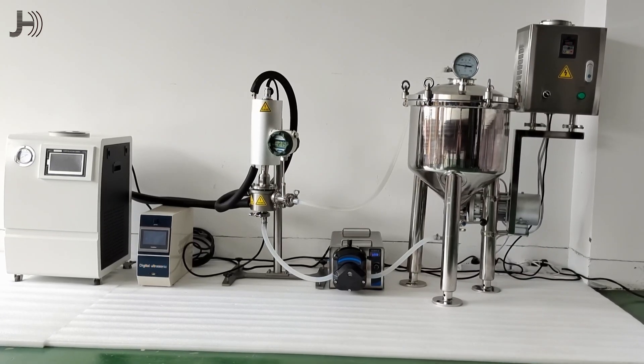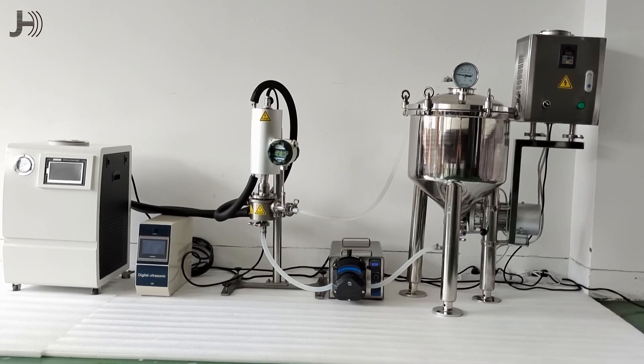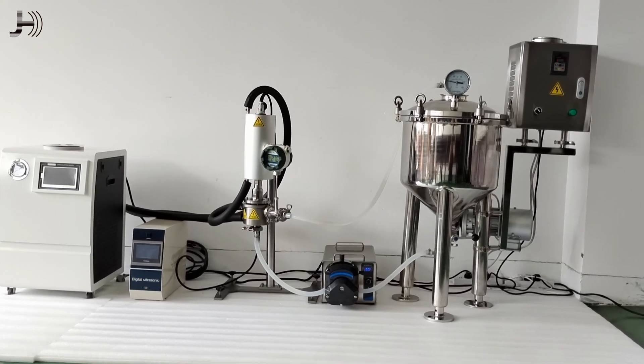Hello everyone, I'm glad to introduce the operation steps of this ultrasonic circulation system for you.